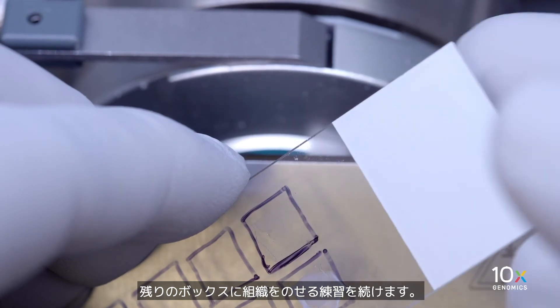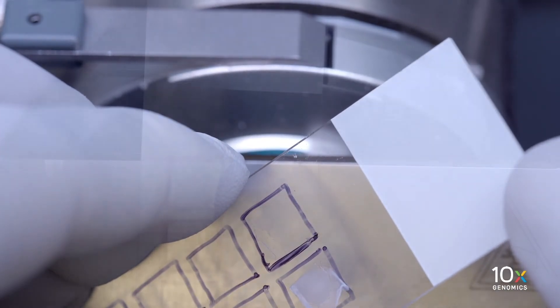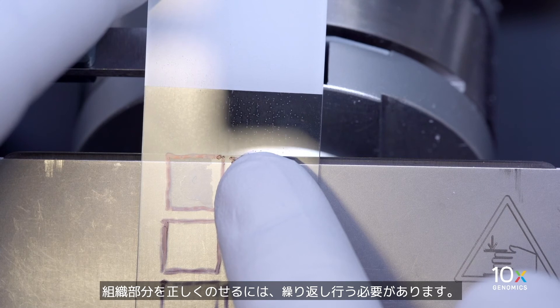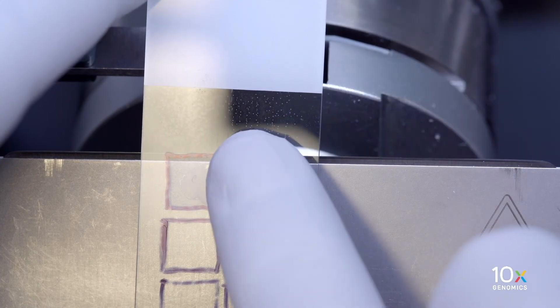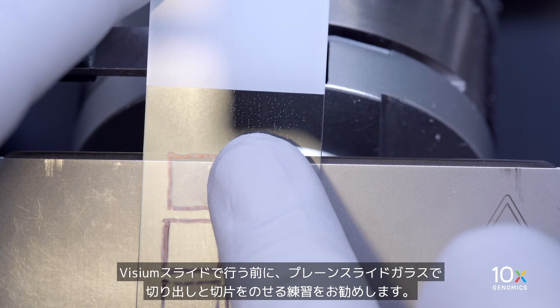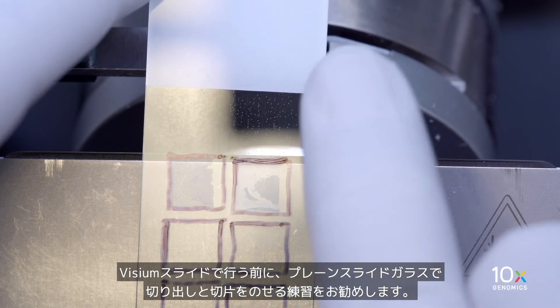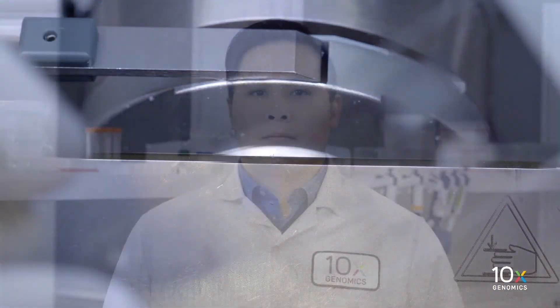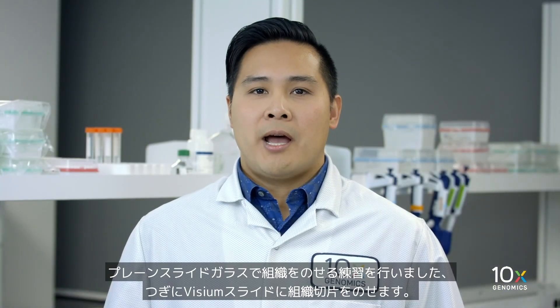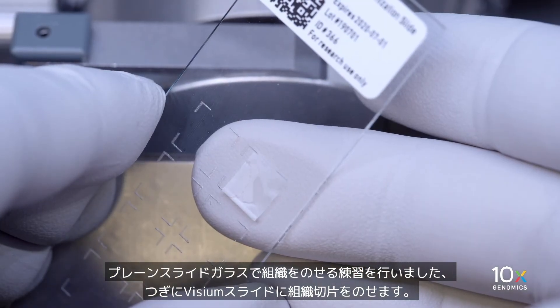Continue practicing section placement on the remaining trace boxes. It may take multiple attempts to correctly place a tissue section. This is why we recommend practicing cryo-sectioning and tissue placement on plain glass slides prior to working with the Visium slides. We have practiced tissue placement on a plain glass slide. Now, we are ready to place tissue sections on the Visium slide.